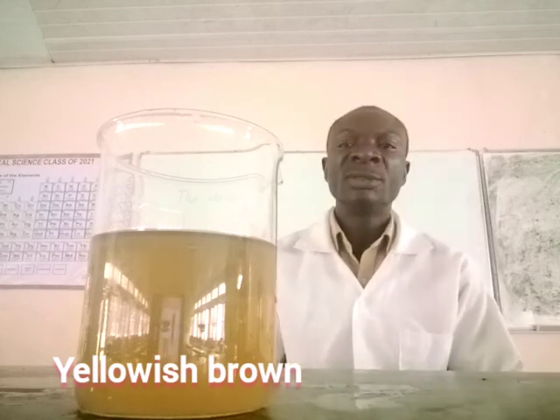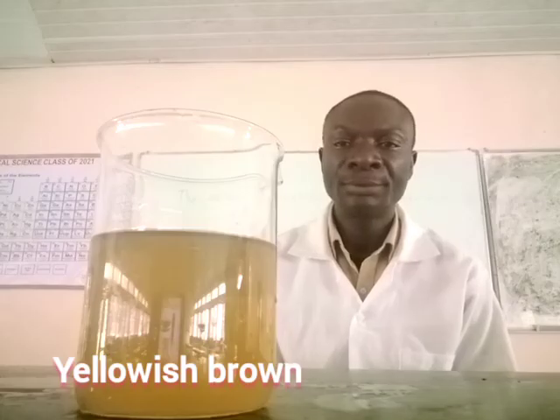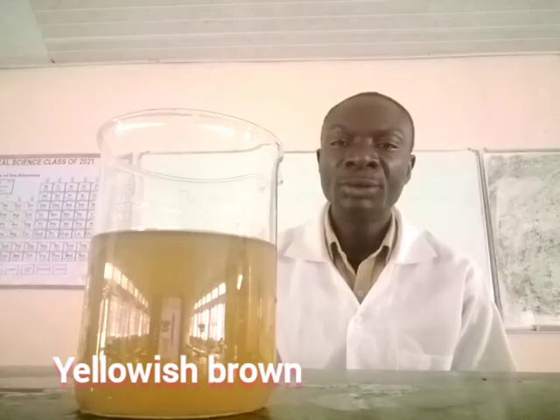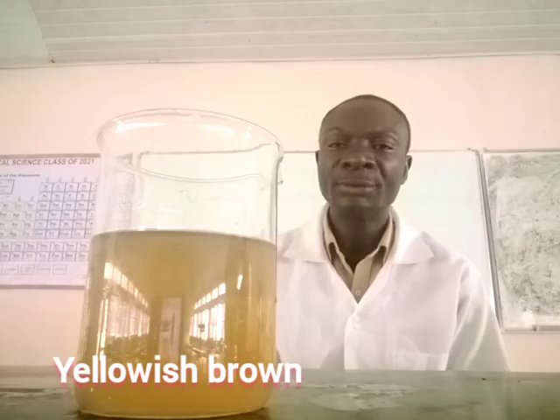Now, this is what we call chemical chameleon. A color change occurs from pink to blue to green to yellowish brown. Chemical chameleon.